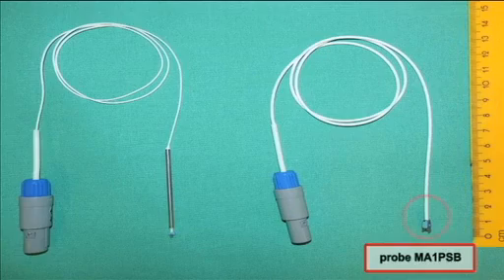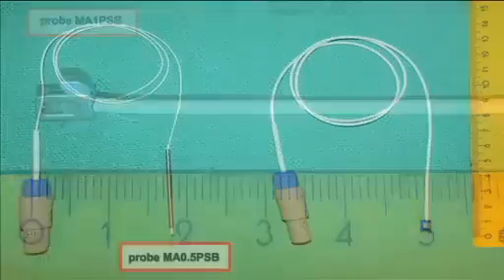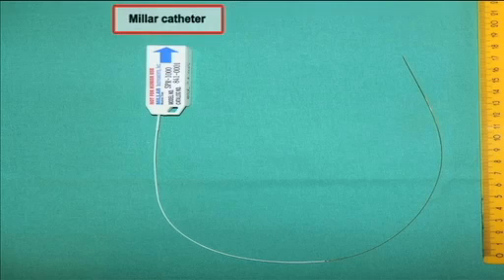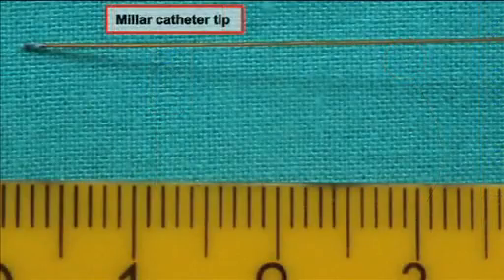This is the blood flow probe MA1PSB for measuring the flow rate of portal vein. This is the blood flow probe MA0.5PSB for measuring the flow rate of common hepatic artery, carotid artery and jugular vein. This is the Millar catheter, a highly sensitive pressure transducer for measuring the blood pressure.